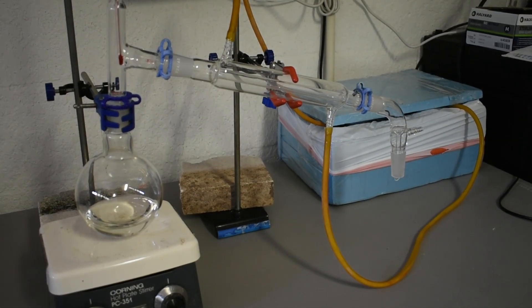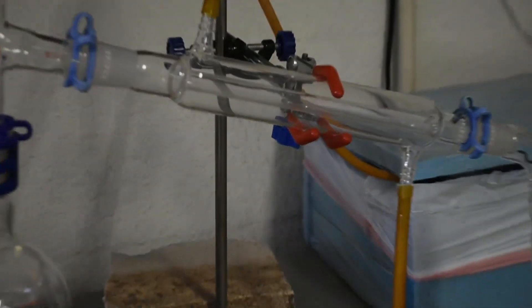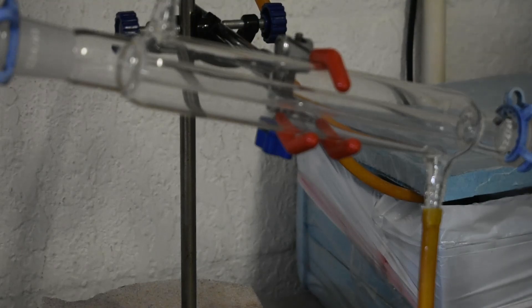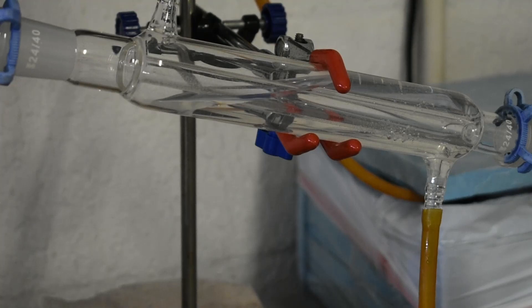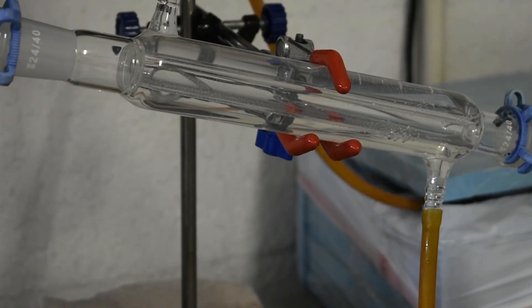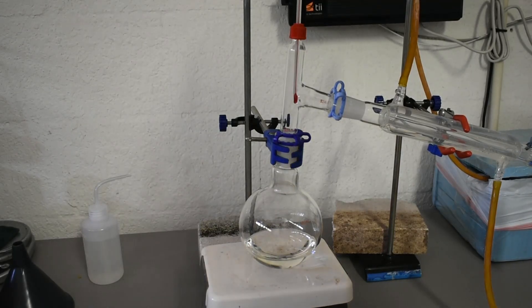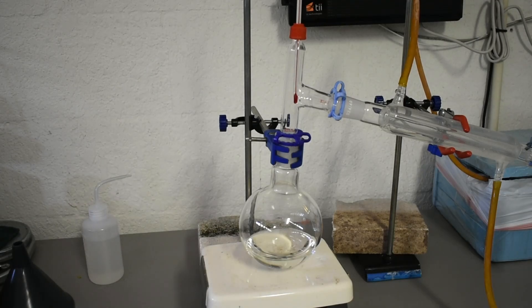Alright, there we go. Let me zoom in. I personally like to watch the condenser water go up through the condenser, so I'm going to zoom in on that so you guys can see as well. Now all I have to do is just turn on the heating down here. There we go. I'm not going to film this, pretty mundane. But I'll come back when we're done.